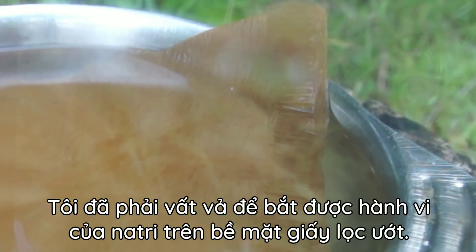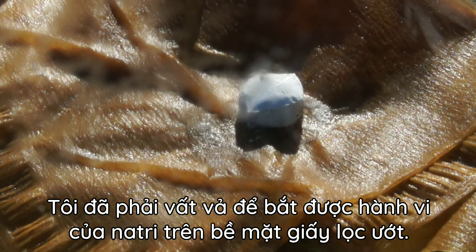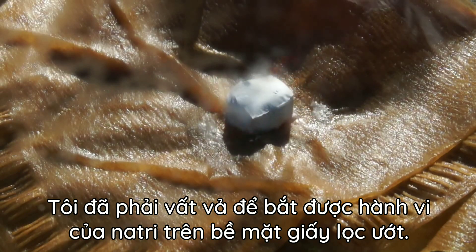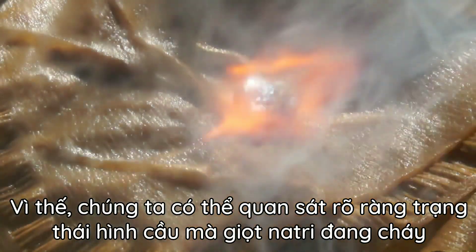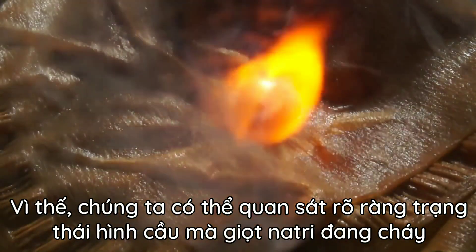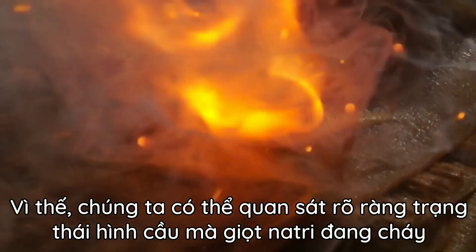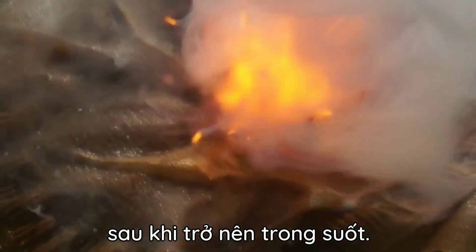I also managed to shoot the behavior of sodium on the surface of the wet filter. We can clearly observe the spheroidal state that the burning sodium droplet acquires after becoming transparent.